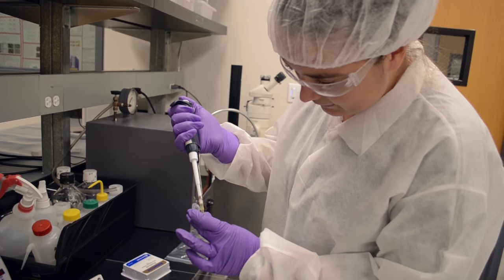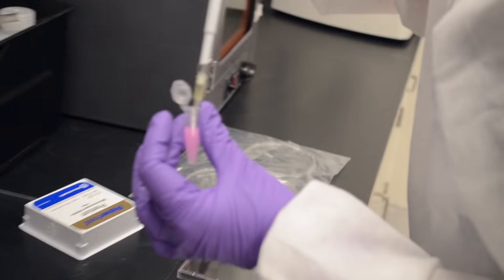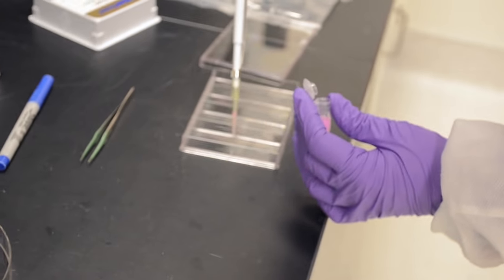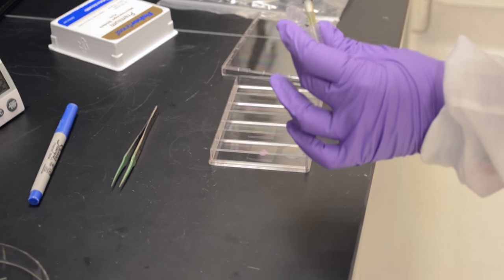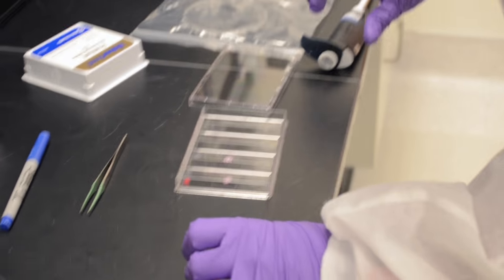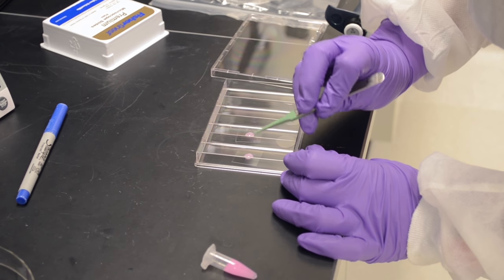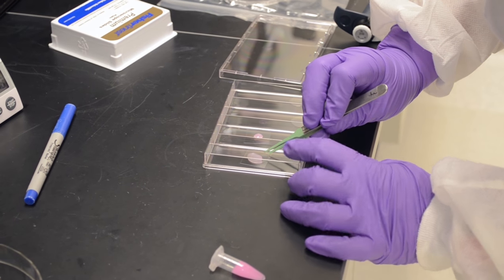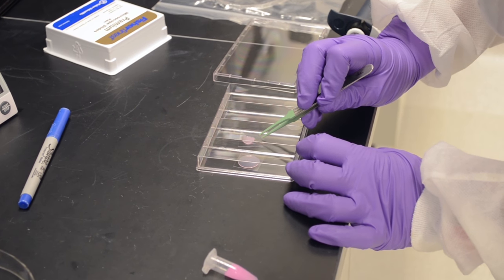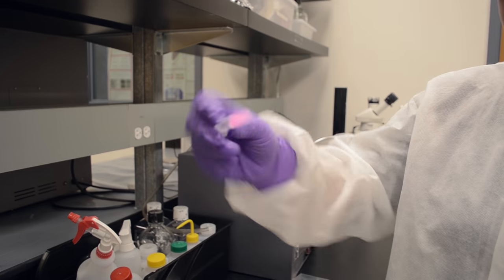And here's where I mix it very well without introducing bubbles. You can see it's pink because it has the beads. Oh, right, the red beads? Yeah. So you can see it's still a liquid. And then we're going to take our little cover slip that was stamped, flip it around and put it on top of the gel like that. And then we wait for it to gel. You can totally see it's a liquid.